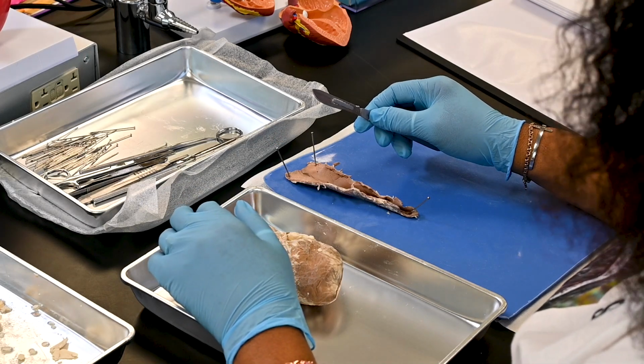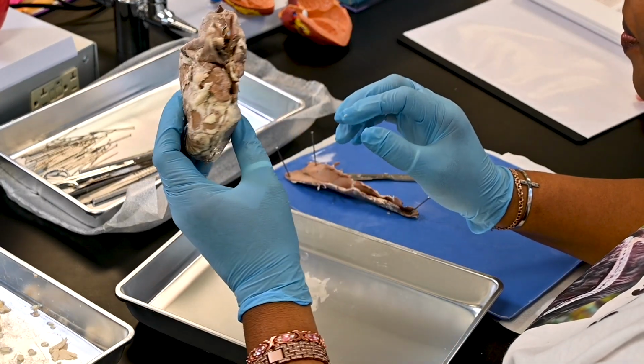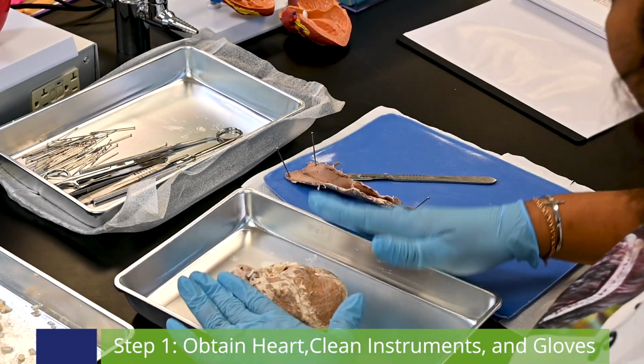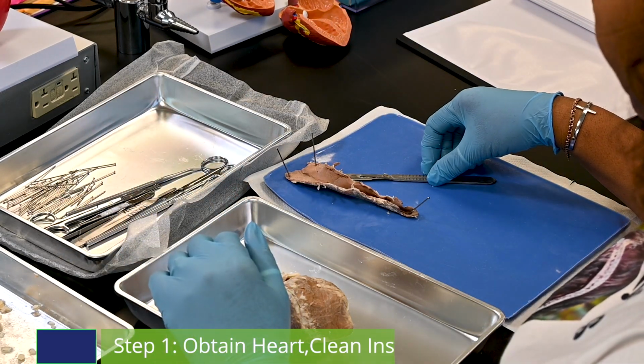Today in Anatomy 2, we are going to dissect a sheep heart. Step 1, obtain a preserved sheep heart, a dissection tray, dissecting instruments, a glass probe, a plastic ruler, and gloves.